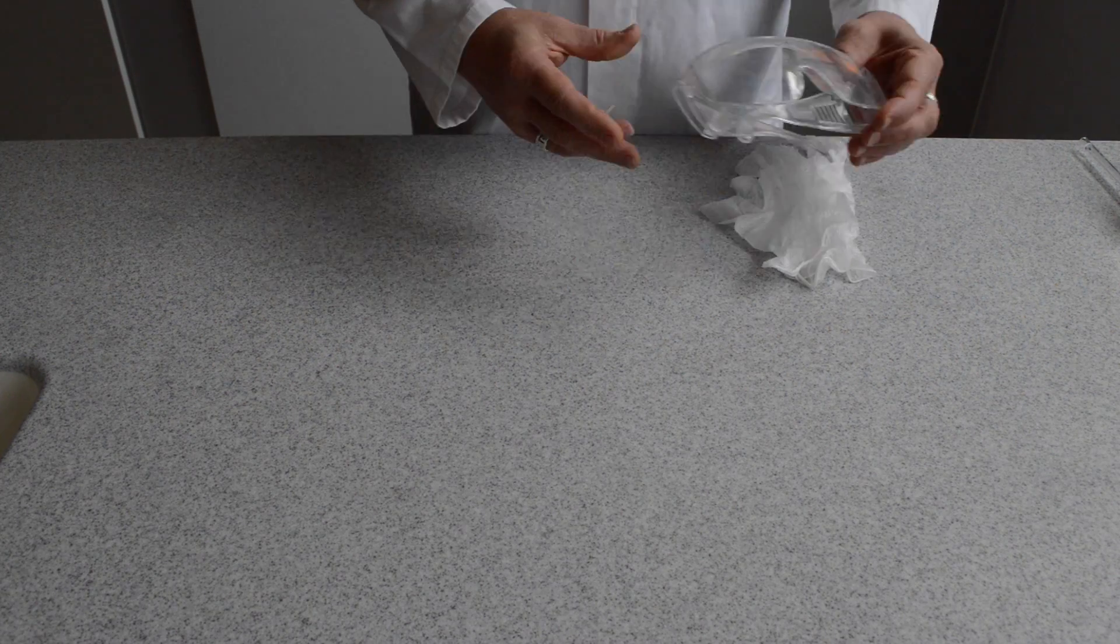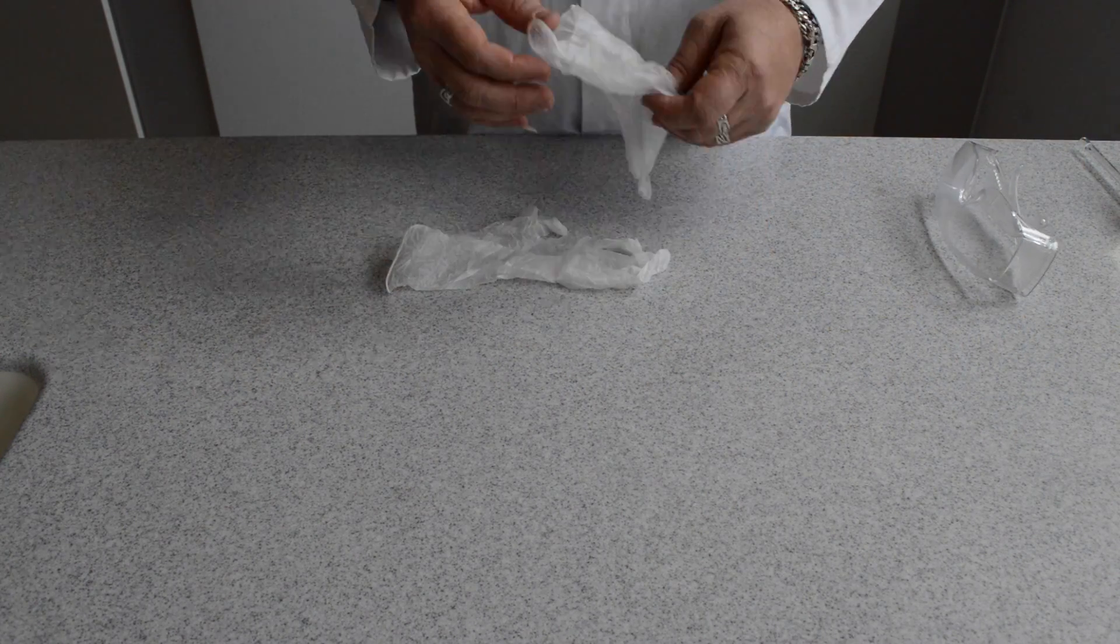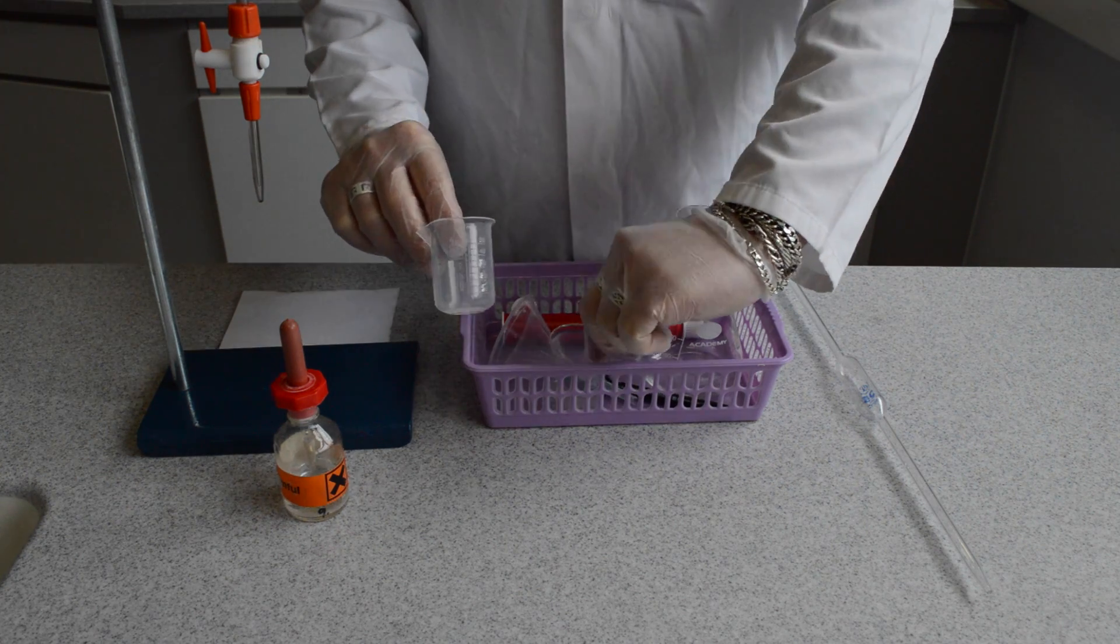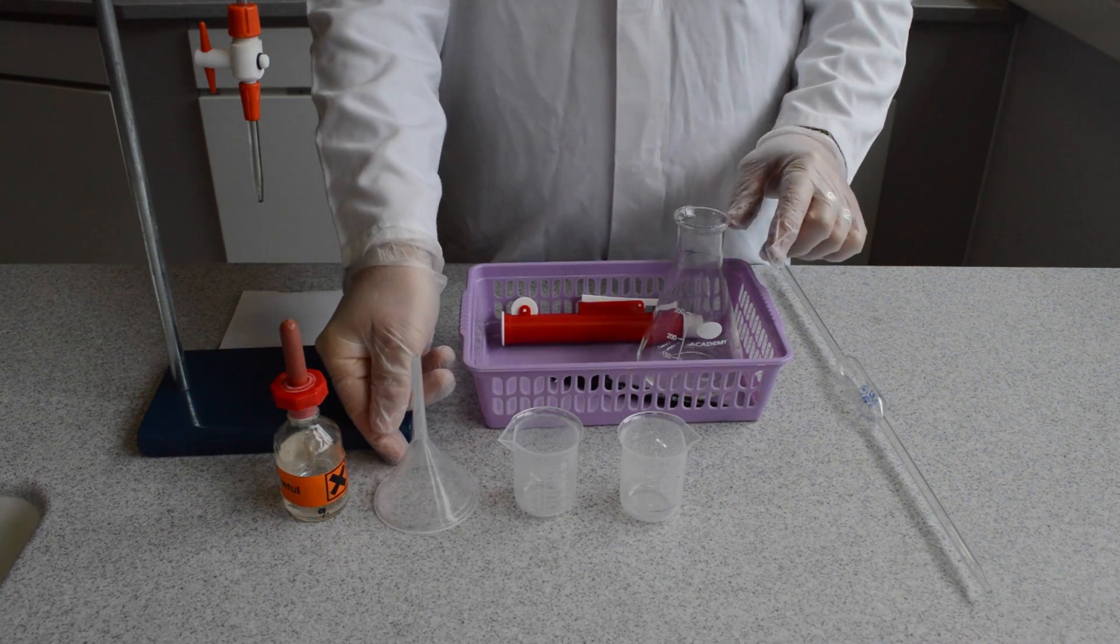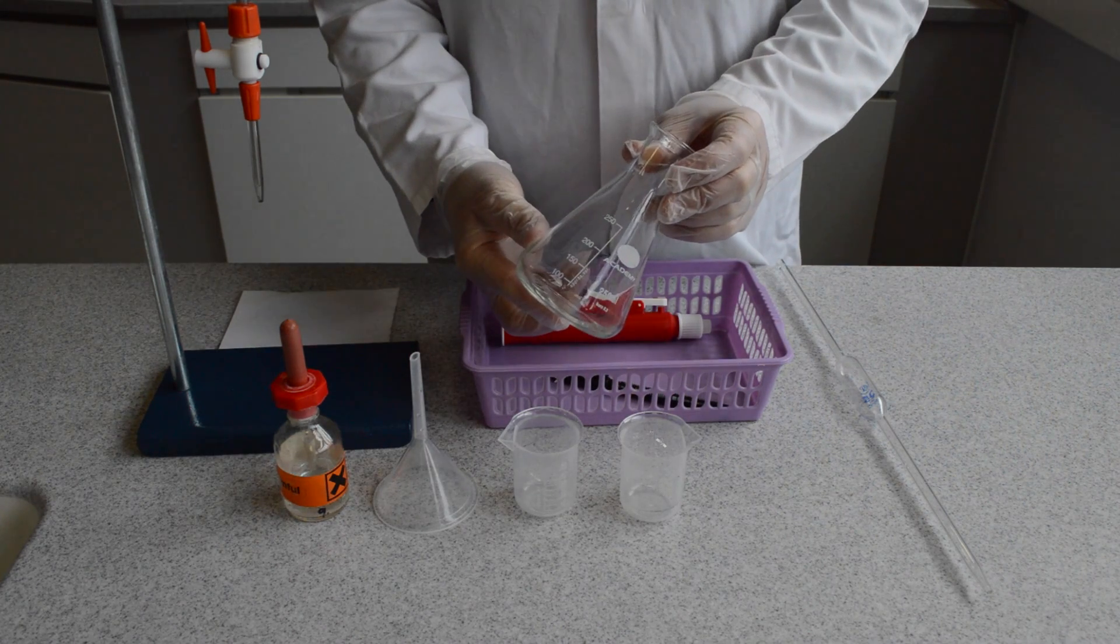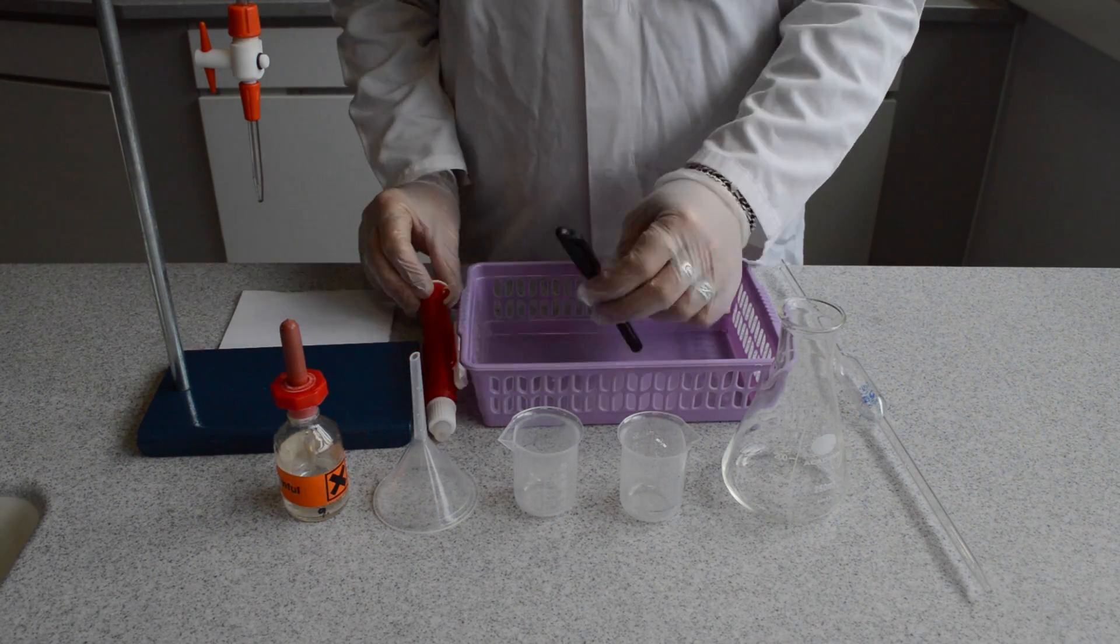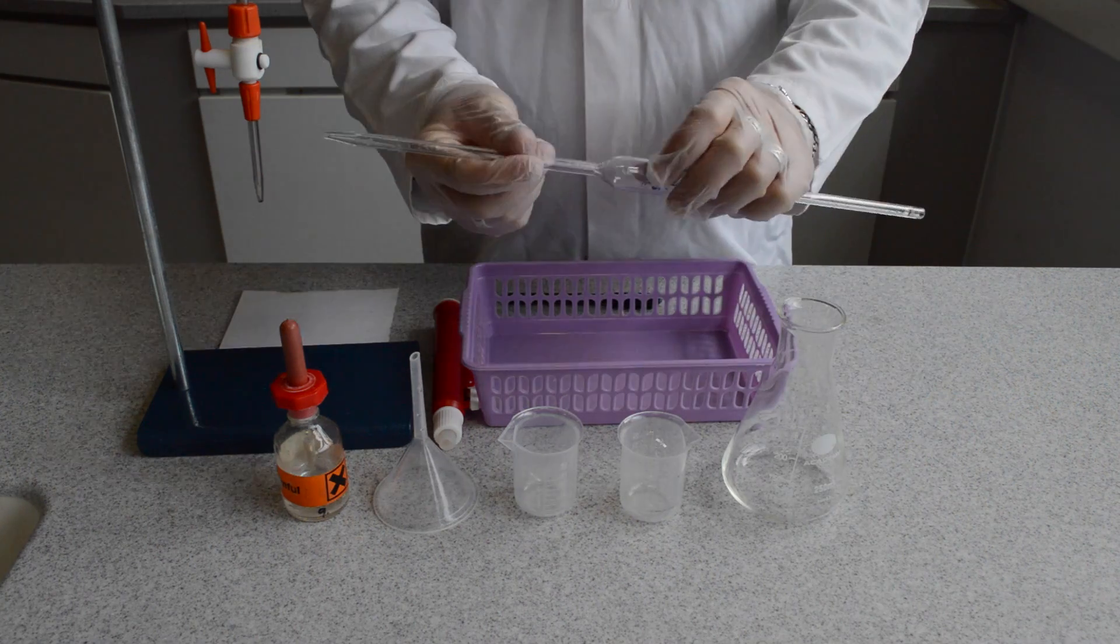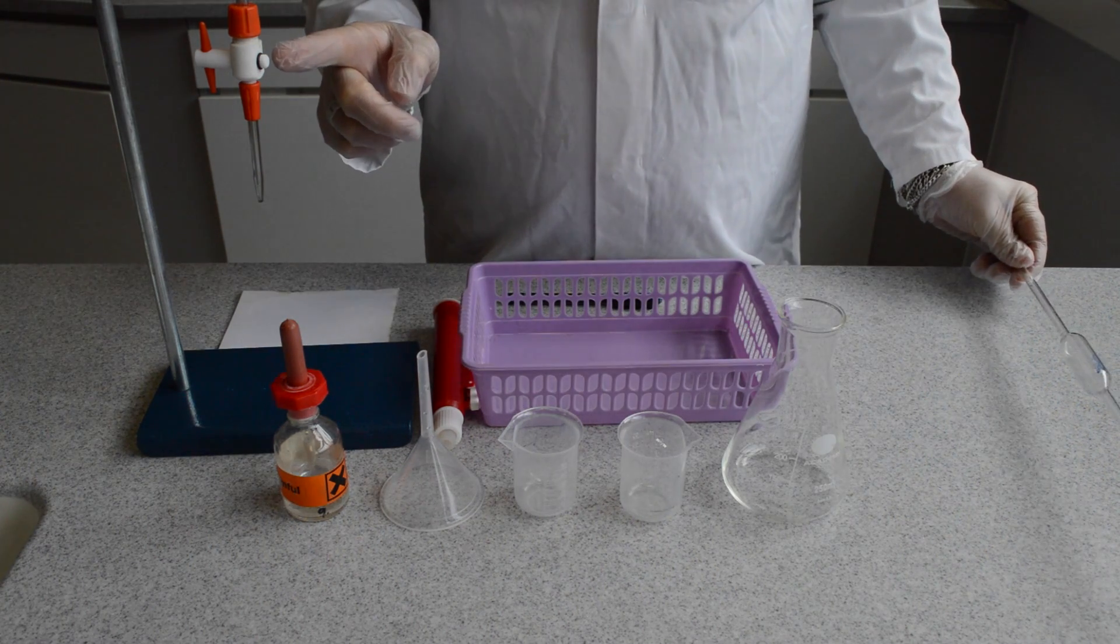Please use your personal protective equipment as directed by your tutor or as indicated by your worksheet. Here is the equipment provided for a titration to be performed. It includes a 250ml conical flask and a pipette filler, a pipette and a burette.